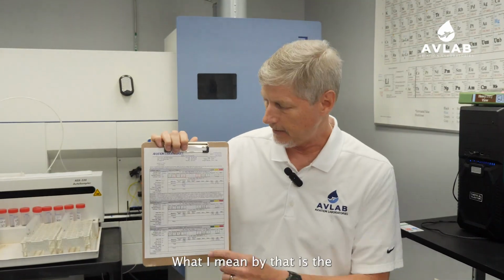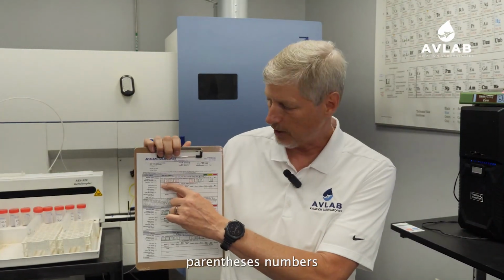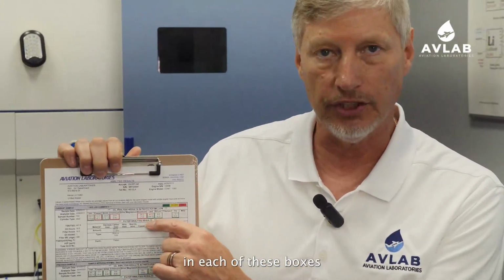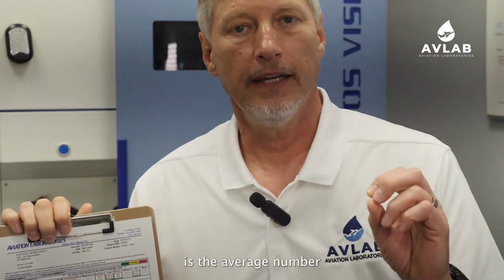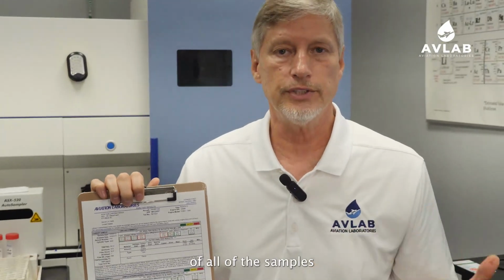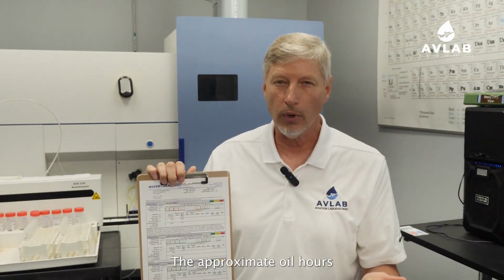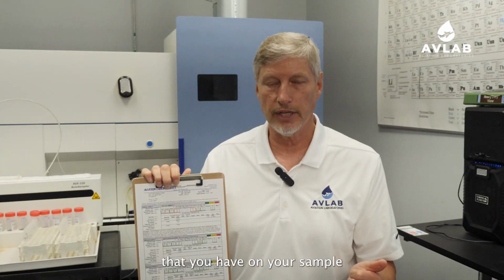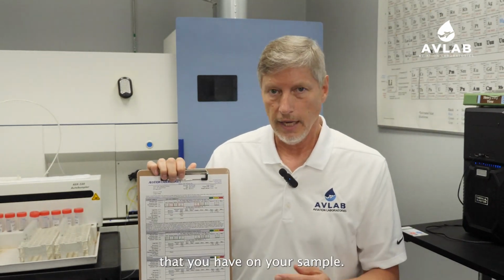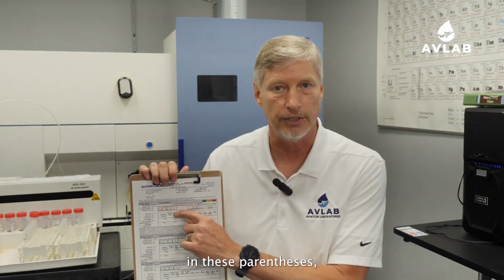The numbers here and the colors here are indicative of changes or absolute values of the sample. What I mean by that is the parentheses numbers in each of these boxes are the average number that we've gotten of all of the samples in our database that are the same engine as yours, with the approximate oil hours and the approximate engine hours that you have on your sample. We average all those and give them to you down here in these parentheses.